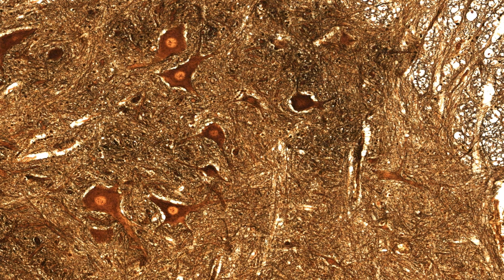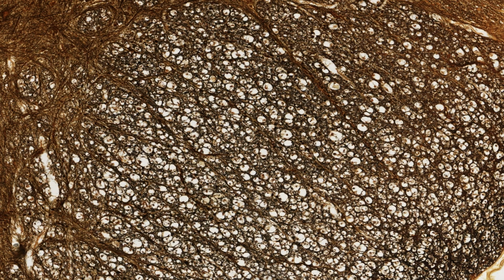This image at higher magnification shows part of the great complexity of neuronal processes that make up the neuropil. That is, the area where numerous synaptic connections occur, almost always in the grey matter. I can trace short segments of axons and dendrites here and here, then associate them with cell bodies in this preparation. Have a look at the white matter here, in this same histological section. The axons in it run primarily up and down the spinal cord, and so are cut transversely.